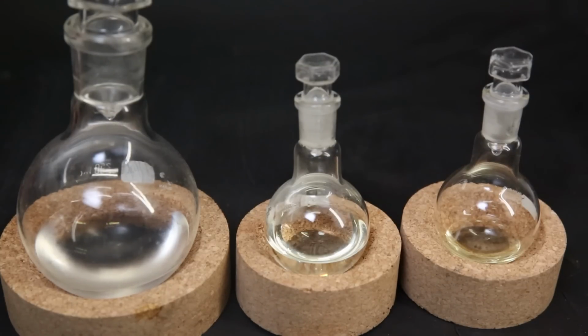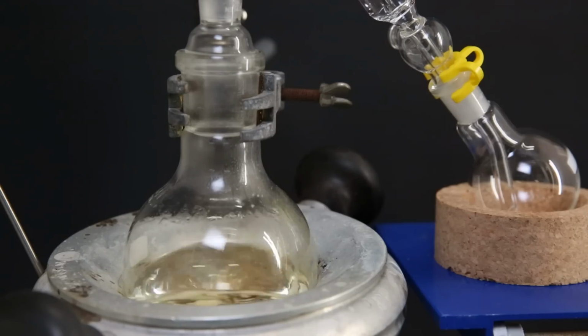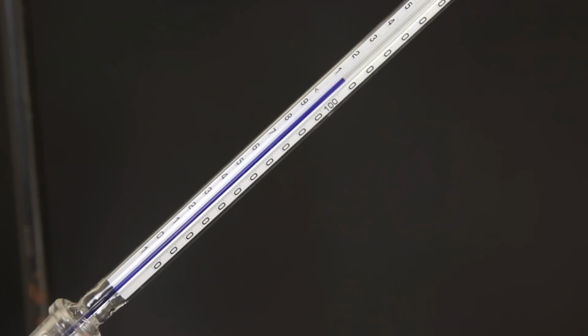I discarded the first full flask that came over since it was mostly just solvent, but the other fractions are somewhat overlapping. I decided to combine all of them and redistill them to get a good separation. This time I set up a short path distillation, because it is easier and it minimizes losses. The first fraction came over up until 110 C.